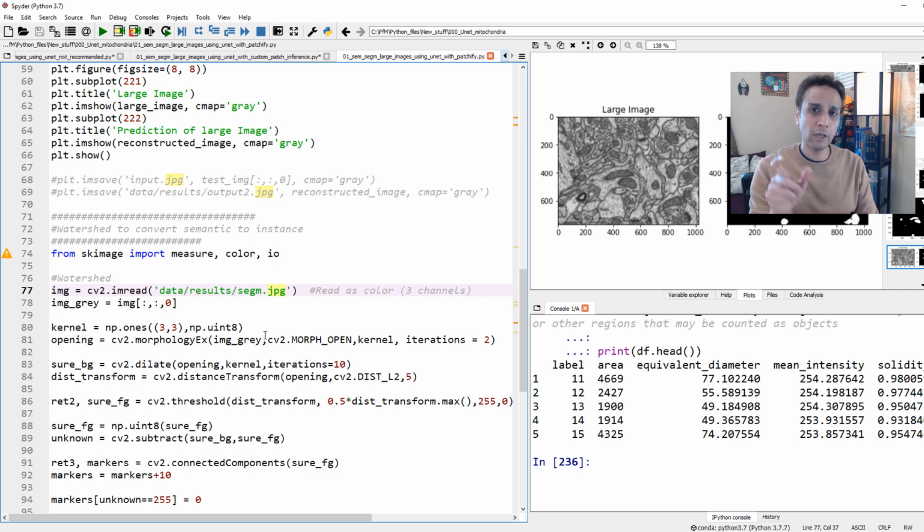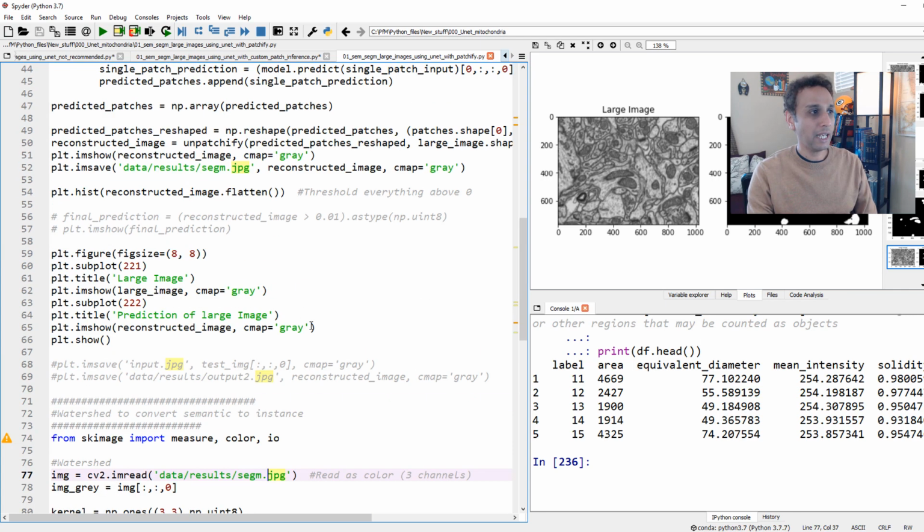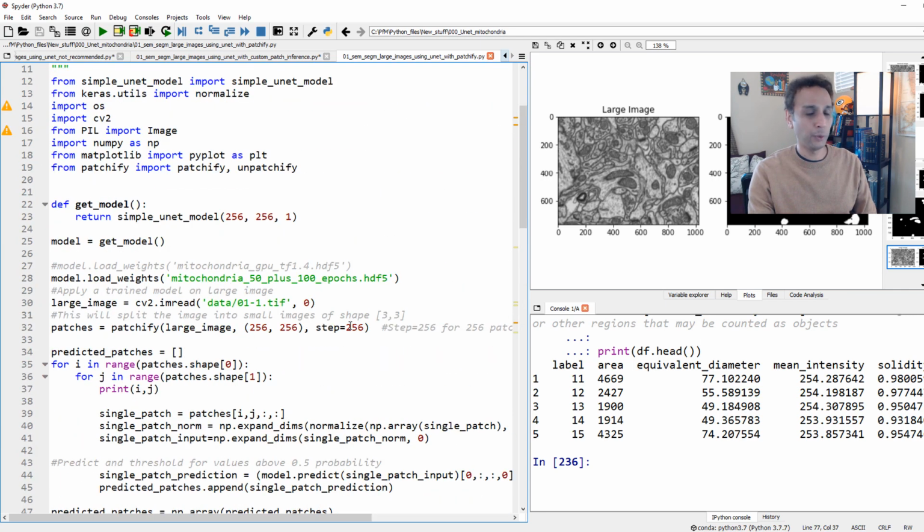Always cut down your images into patches, and I showed you a couple of ways to handle patches. Now, the best way to actually deal with this without having the edge effects, because think of 256 by 256 at the edges. If you have a small object just starting, but then it continued in the next frame, it will be fine in the next frame, but in this frame we may not have gotten good results right here. So it would be nice to actually have a sliding window type. For example, if I just do 128 right here instead of 256, this would now be 5 by 7, I guess. Let's run this, okay?